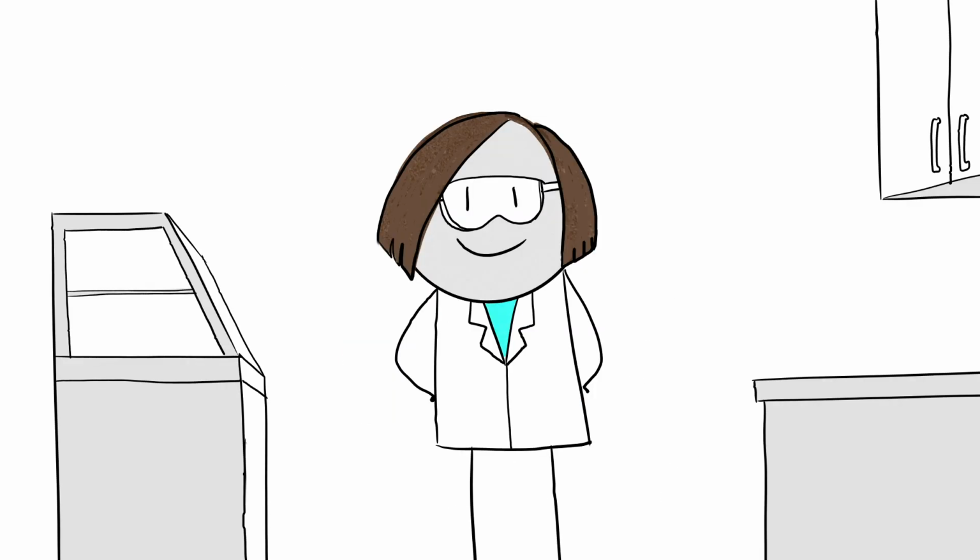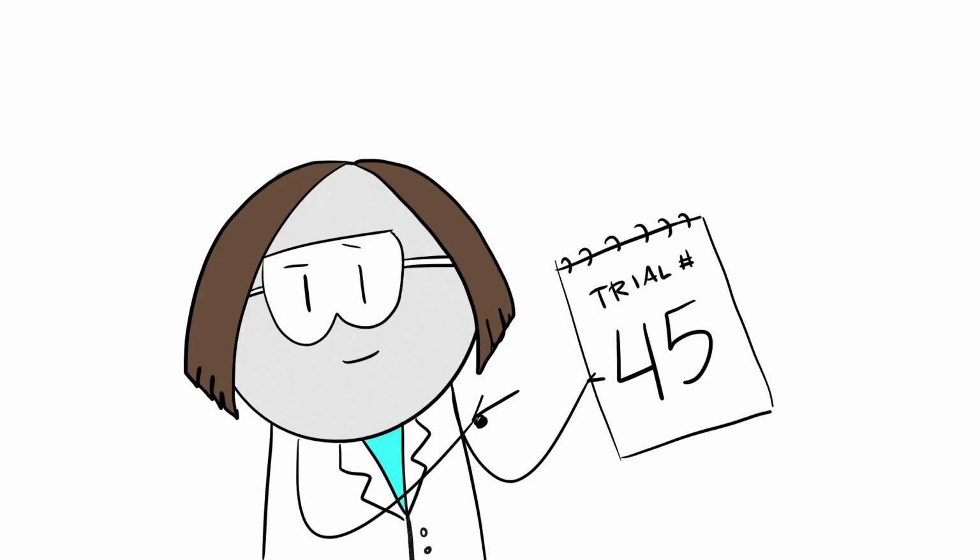Working alone in the lab again? Doesn't that seem a little unsafe? I see, you've done this a lot, and everything's going fine.